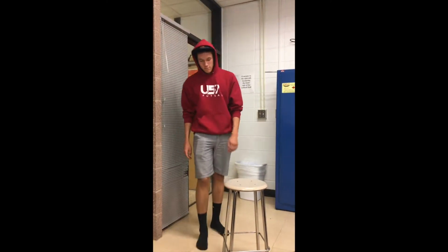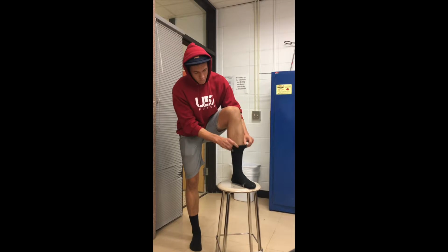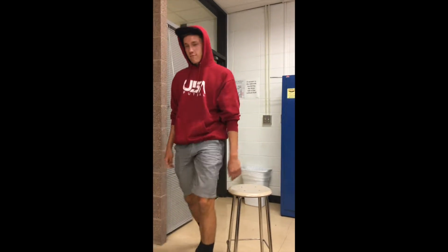This is an example of something not to do when in the lab room. This is what you should do instead.